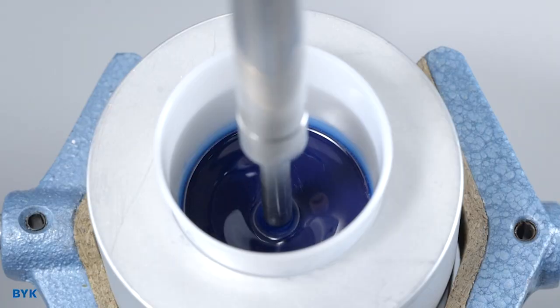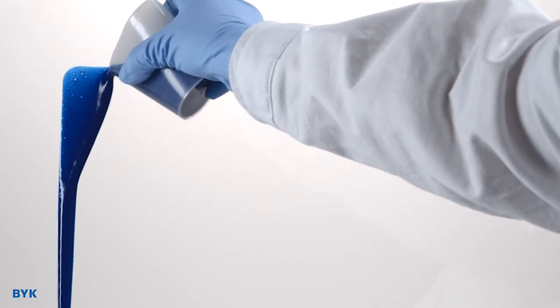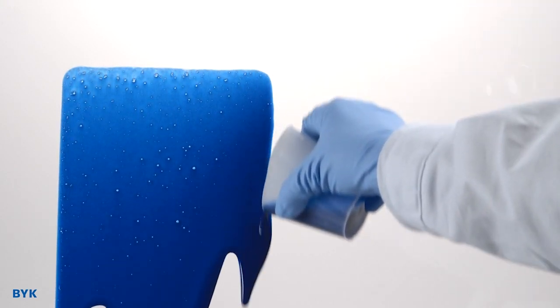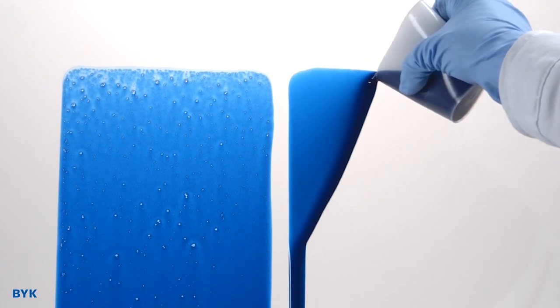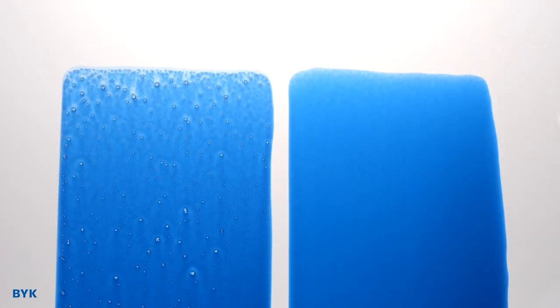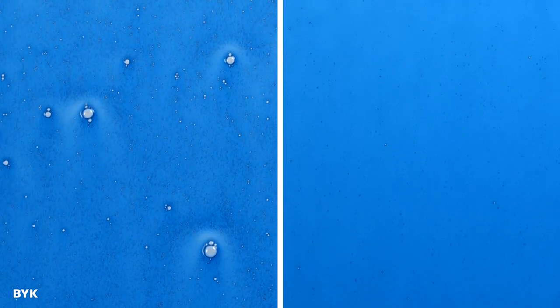Our lab also conducts a pour-out test, a unique method independent of the end use. This method incorporates foam into the sample by mixing it for 3 minutes at 4 meters per second mixing rate. In this test, foam generation could be higher due to incorporating a reasonable amount of shear during the mixing process, so defoamer efficiency will be easily noticed.